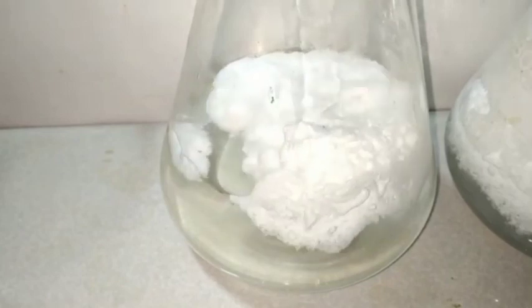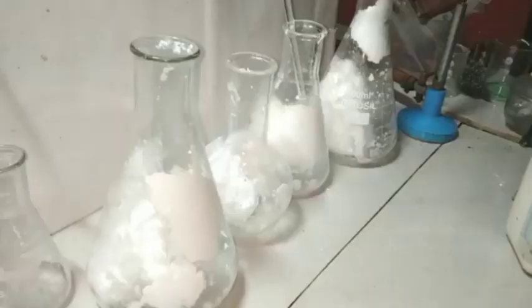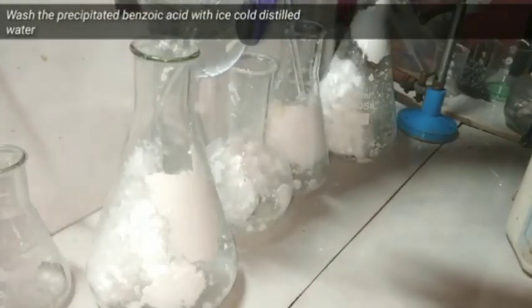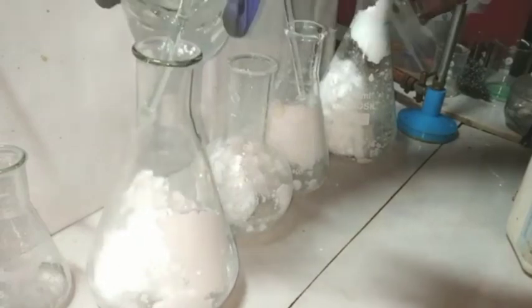This is the crude benzoic acid separating out as it is insoluble in cold water or sparingly soluble at room temperature. The precipitate of benzoic acid formed was too much in volume that 2 of my 500 milliliter flasks couldn't afford it, so I had to take them in various vessels.